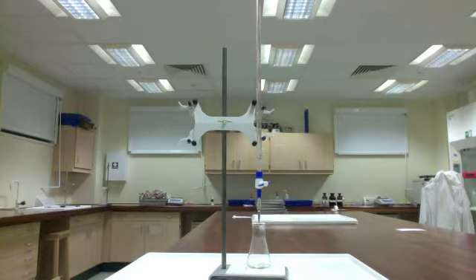To standardize a titrant, we use something called a primary standard. All a primary standard is, is a solution that can be made of exact known concentration, so it's made with a very stable solid. The solution that we are using today is KHP. KHP is potassium hydrogen phthalate, and the formula for it is given to you on the lab handout for standardization of sodium hydroxide, as well as the balanced reaction.